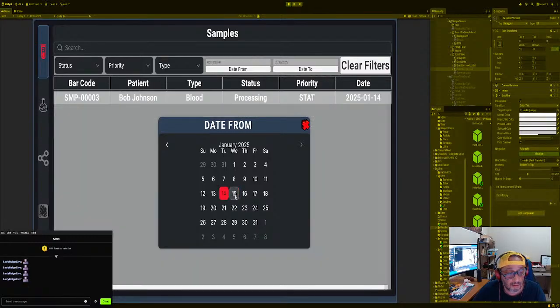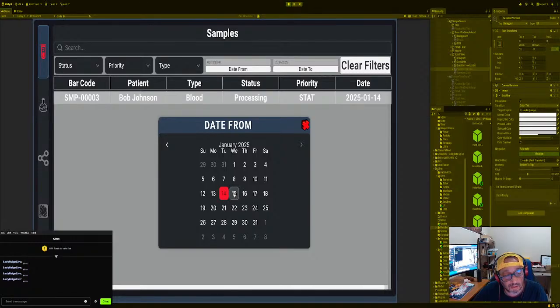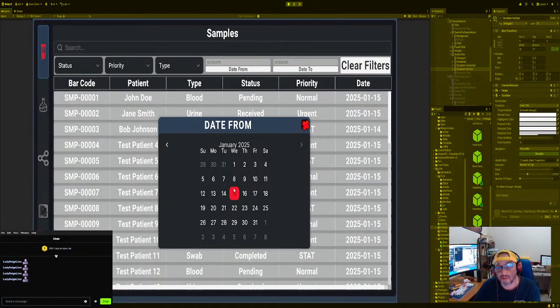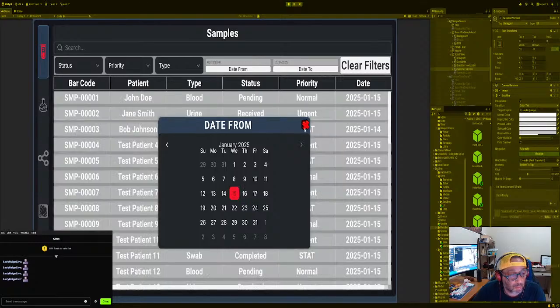Beautiful calendar, beautiful thing. Okay, now you also can do, which I don't suggest, as soon as somebody clicks on a button, it fixes and then the calendar disappears. Some people like that, some people don't. We could put it in the user settings if you want to. But for right now, I'm just going to leave this alone. Definitely leave that alone, right? Now, we got that working. That's working great. All right.